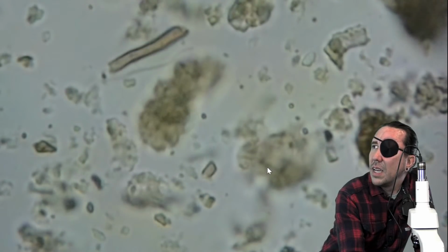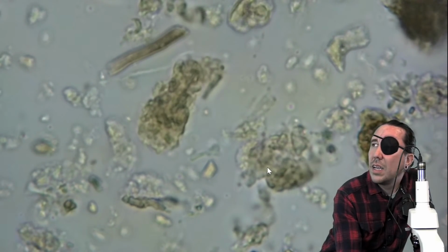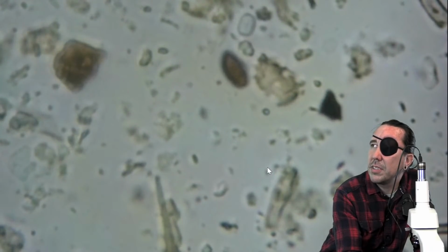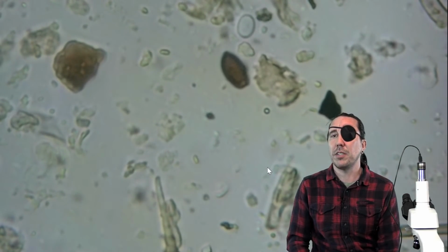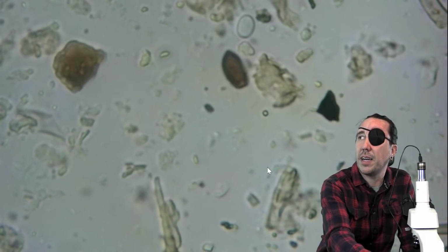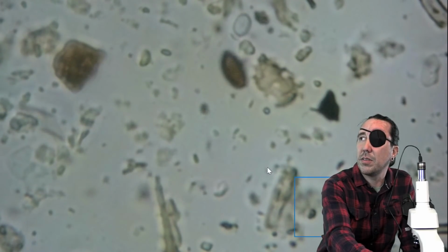A couple of questions for Troy. Someone is asking about pointing out humic and fulvic acids. Oh, yeah. I said I was going to point that out, and then I kind of was looking more for microorganisms. Someone in the audience is wondering about humic and fulvic acid, so I'd pointed out one of those aggregates where we could see humic or fulvic acid, and I'll make sure to keep an eye out for more.